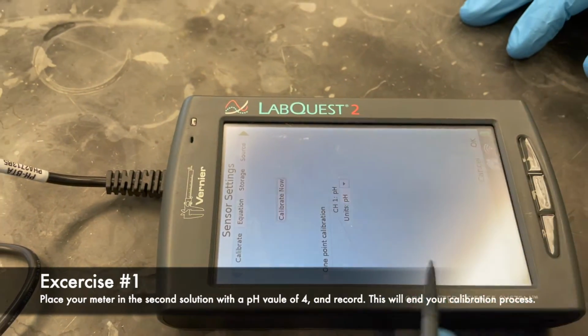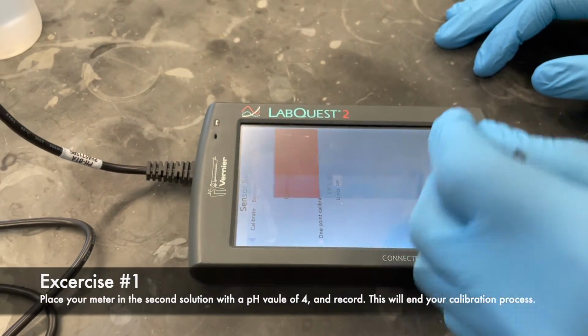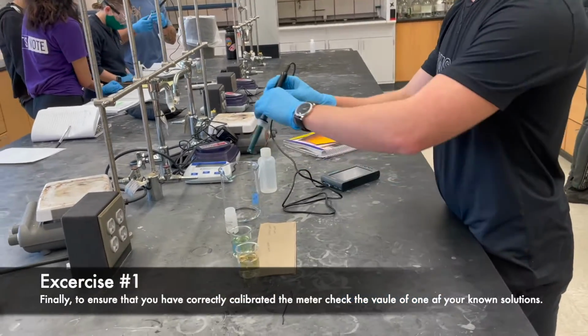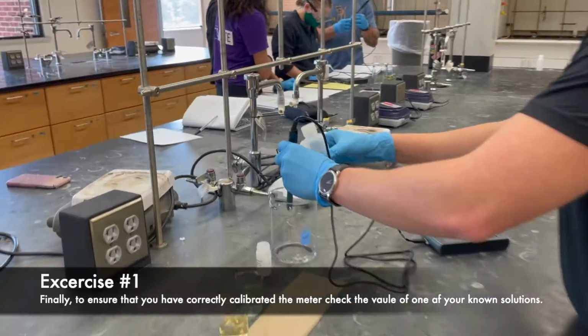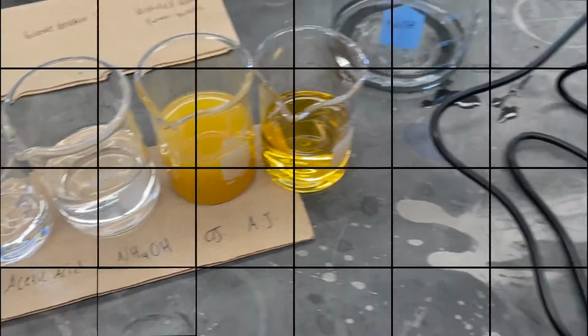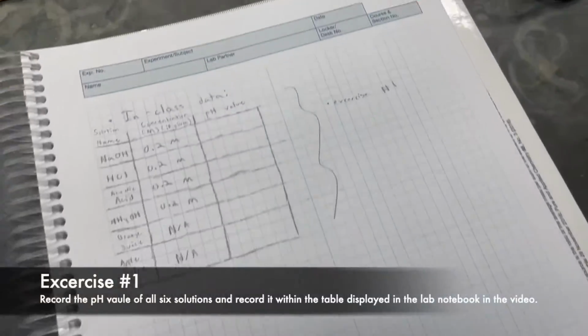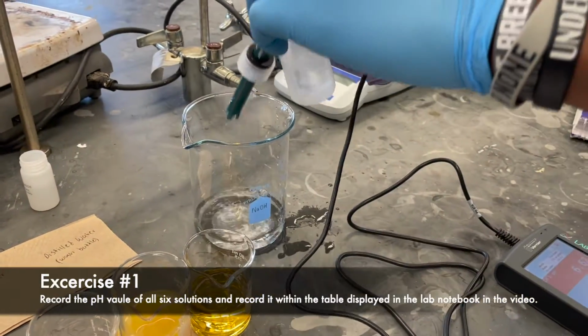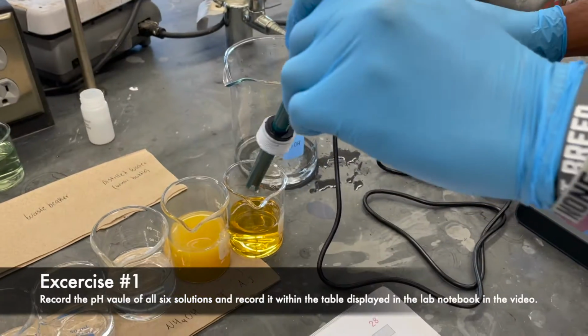In order to verify that your pH meter is correctly calibrated, test your known solution of pH 7 and make sure it is reading a value of 7. Obtain the 6 solutions and record the pH values for all 6 solutions in the table provided. Be sure to rinse with distilled water after each test.